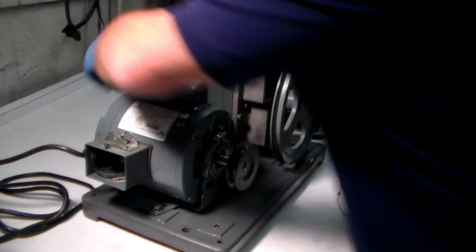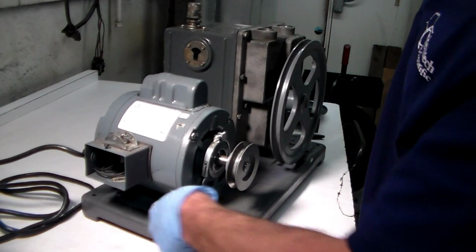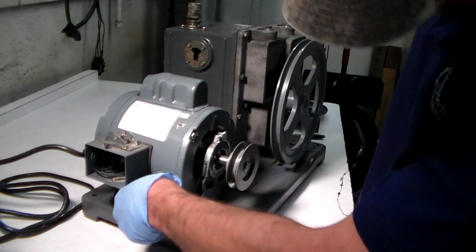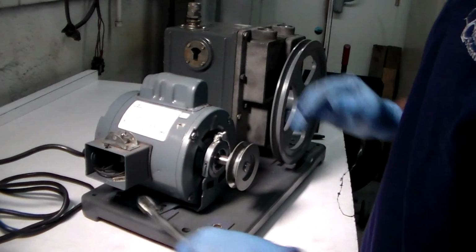And what you do is you take your wrench and you tighten the 2 easiest bolts to get to, which are the ones out here on the outside of the motor. You tighten them up. You don't have to crank down on them because they're not going to go anywhere. You're just going to give it a snug fit.